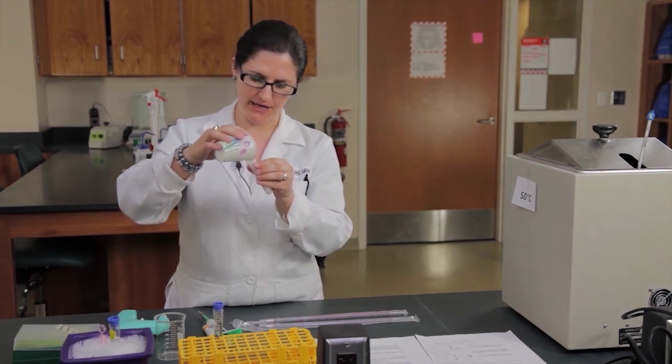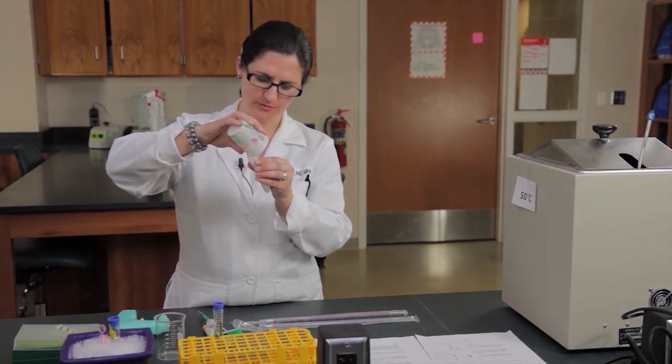So in that water, we should have enough epithelial cells for our extraction. So I'm going to pour the water back into my tube.